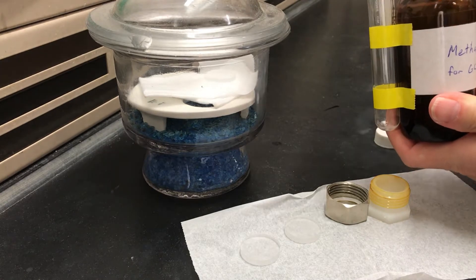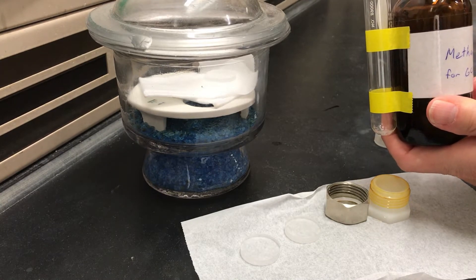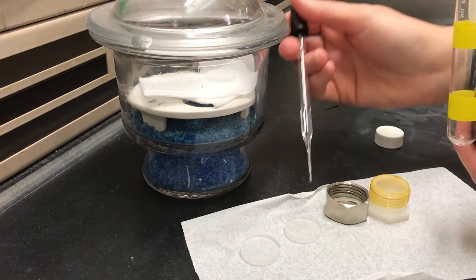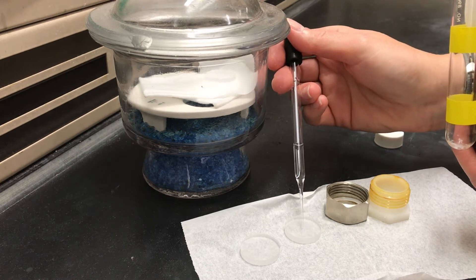Then you'll take whatever sample you want to analyze and you'll get one drop of that and put that on one of the salt plates. Here I'm using methanol.